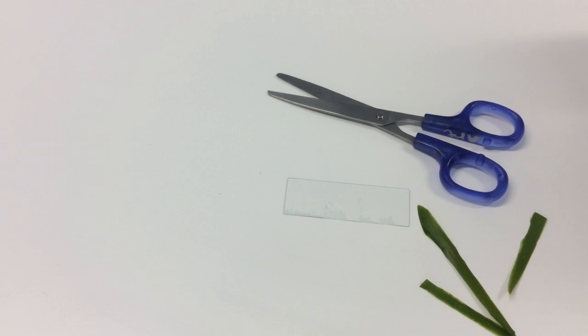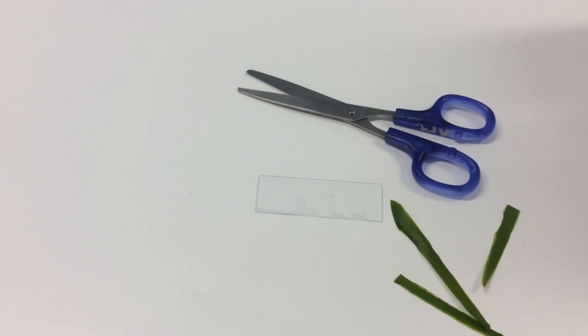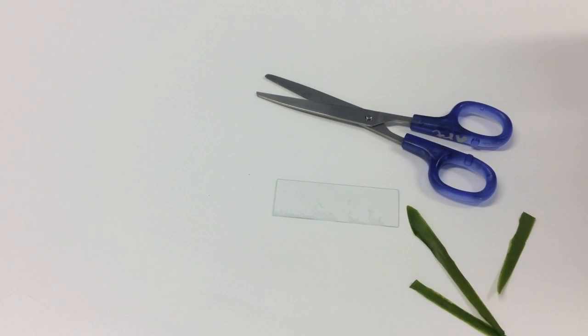Hi, welcome to another science masterclass. Today I'm going to show you how to prepare a slide. This one's going to be a dry mount slide. My name is Mr. Saligaris and this is part of my year eight science biology course.